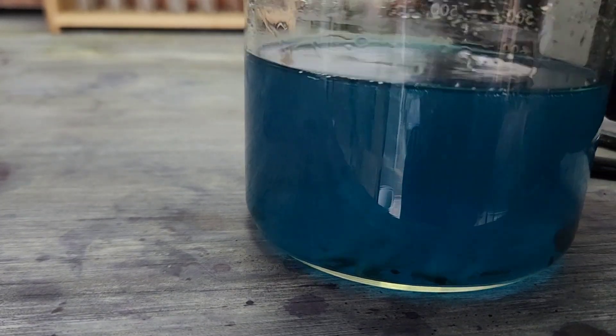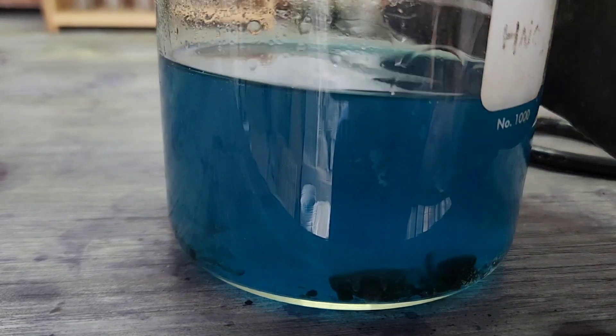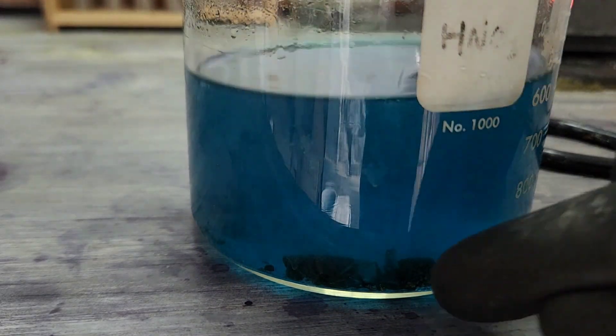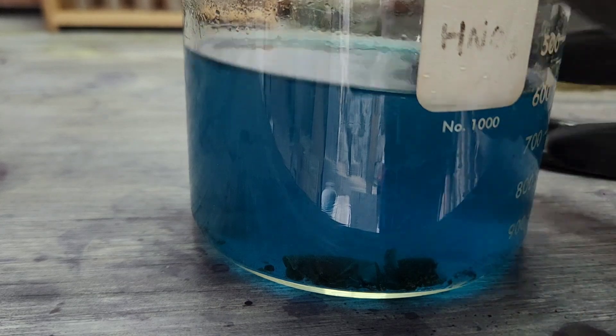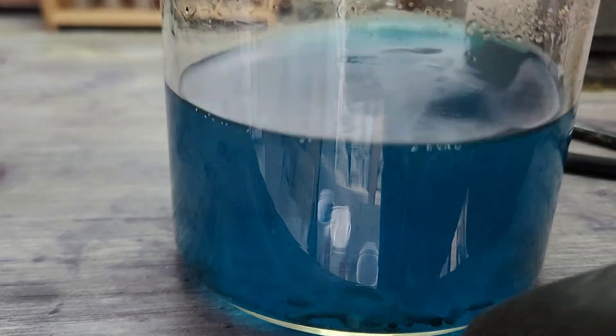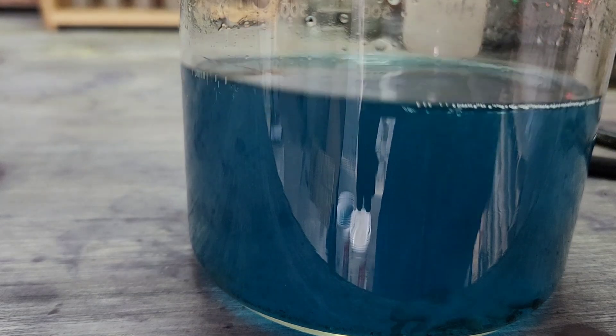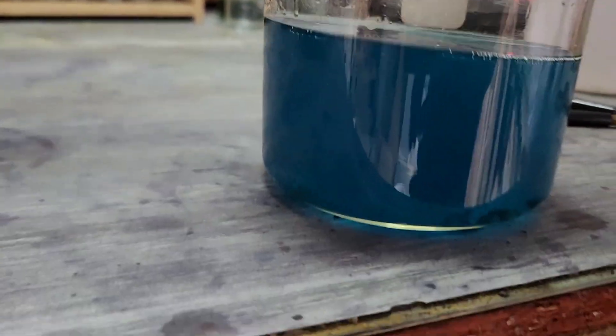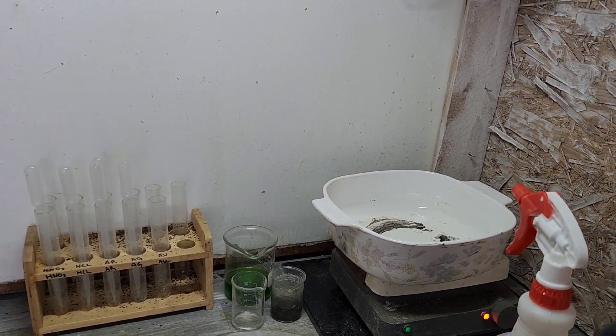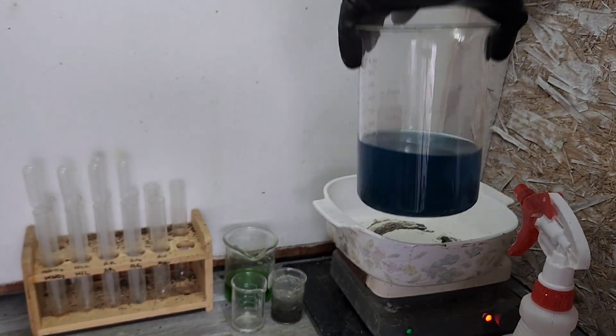I think we're just gonna leave that. We'll see what happens. Maybe a little bit more. Most of that's gonna be that epoxy, right? So in reality, we just have a couple of little chunks left. Perfect. It's coming together.